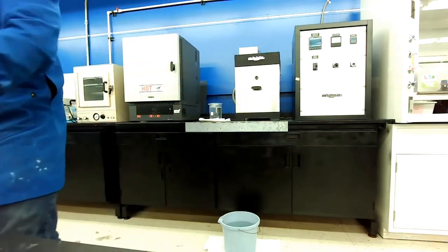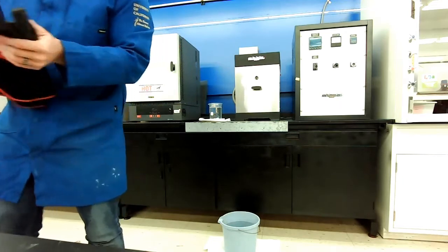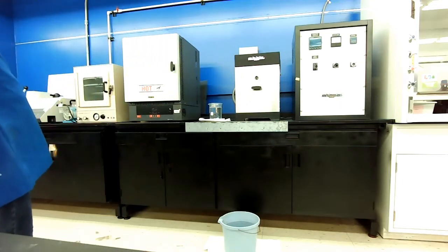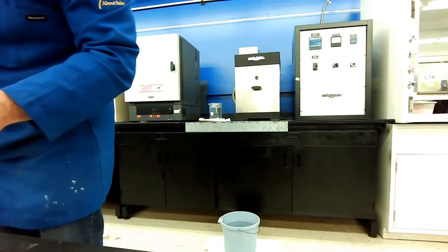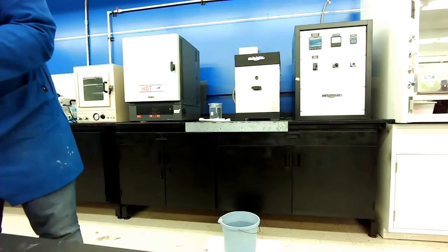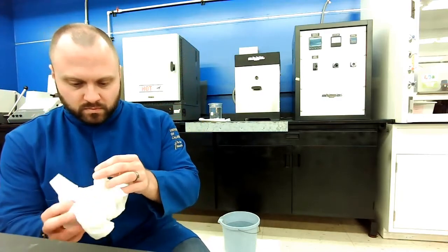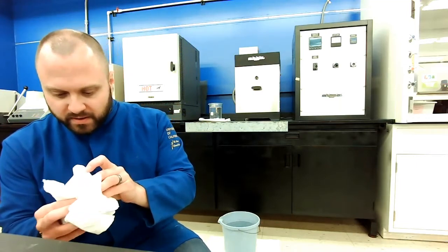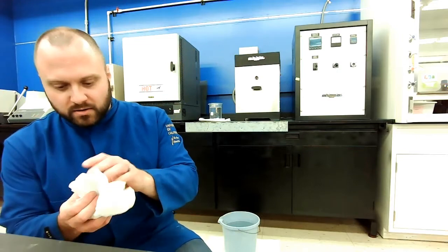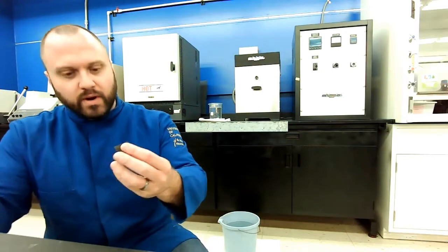Taken my sample. Done my different treatments. And now I have 2 of my samples ready. Take this out, dry it off. What's kind of cool is a lot of the outer shell, so some of that oxide that formed at high temperature, actually broke off when I quenched it.